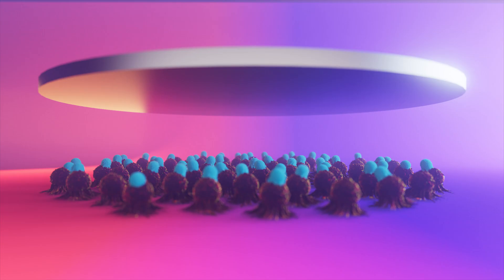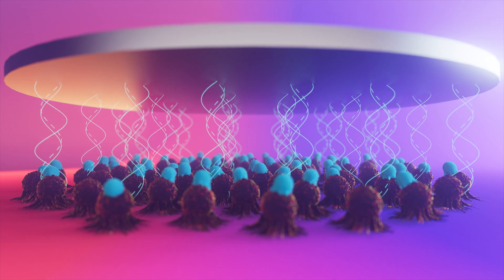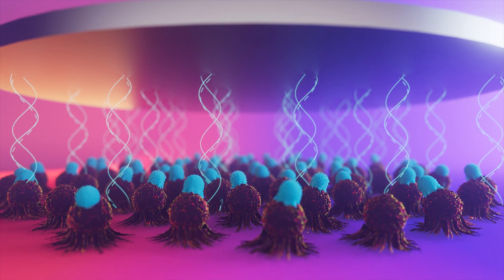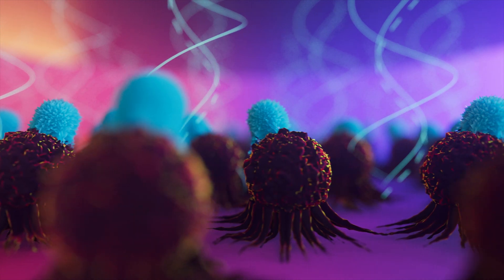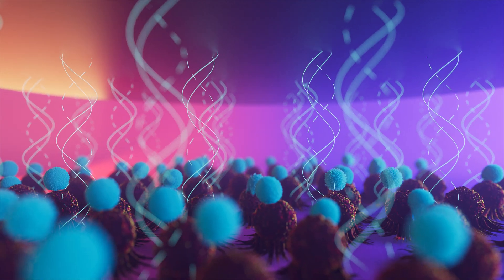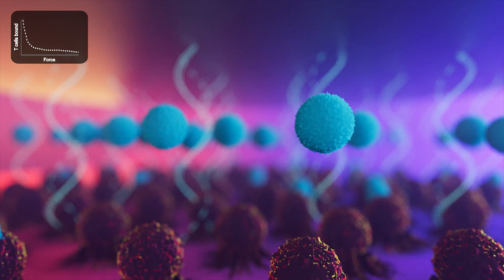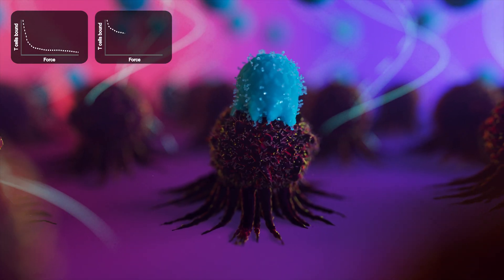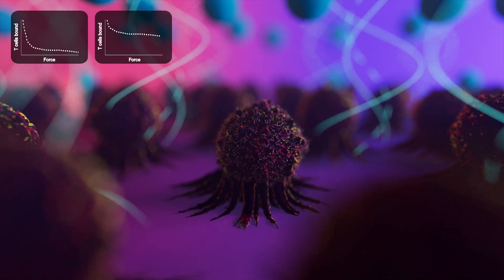Above the chip, a piezo element generates acoustic waves resulting in upward forces, pulling the effector cells away from the target tumor cells. The effector cells with the lowest avidity will detach and accumulate at the node, while those with higher avidity stay bound until the acoustic force grows sufficiently strong.